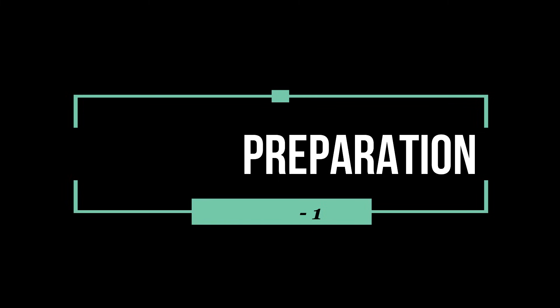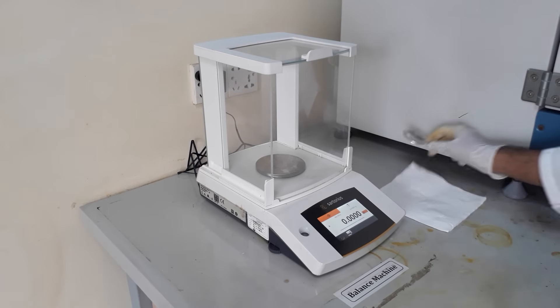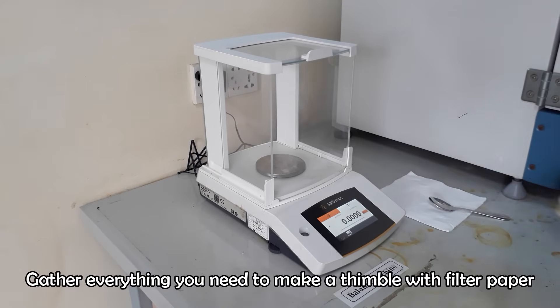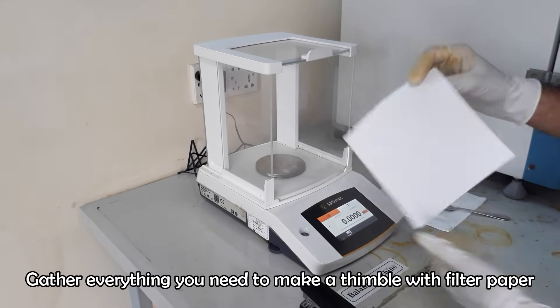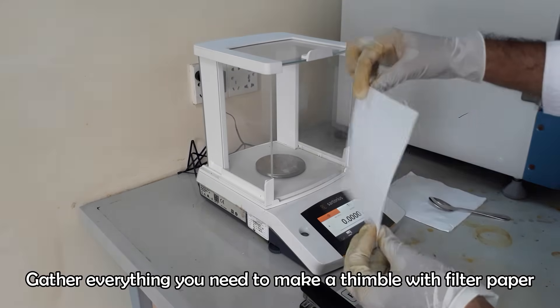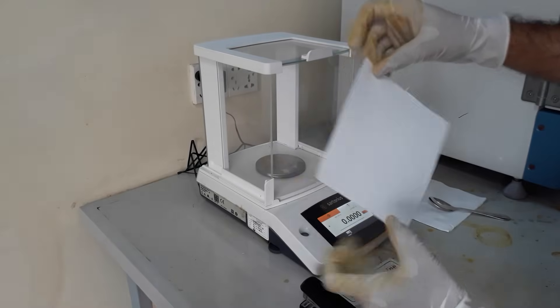First of all we have to make a thimble with filter paper, to which the sample will be taken for testing. Take a square block of filter paper and make a narrow thimble with it by folding and wrapping.